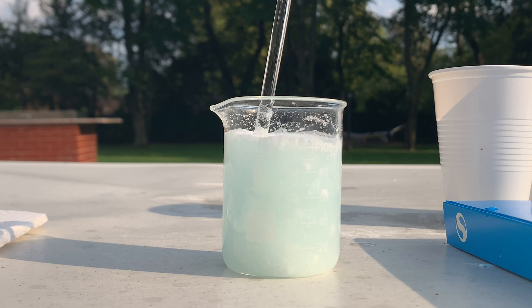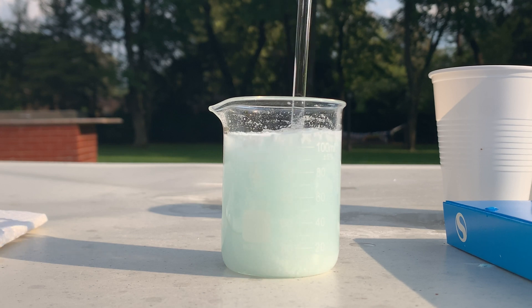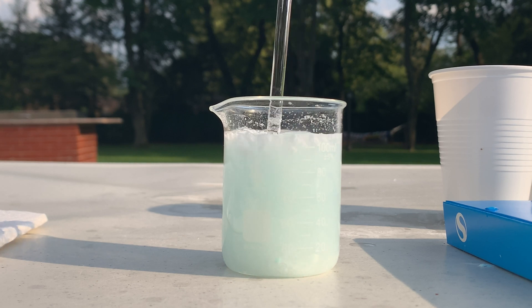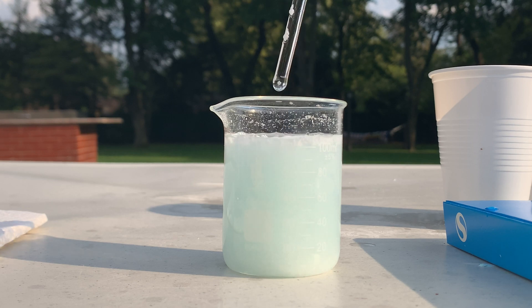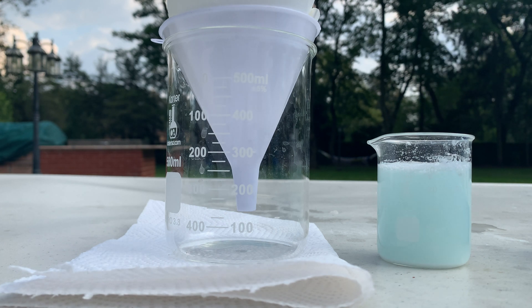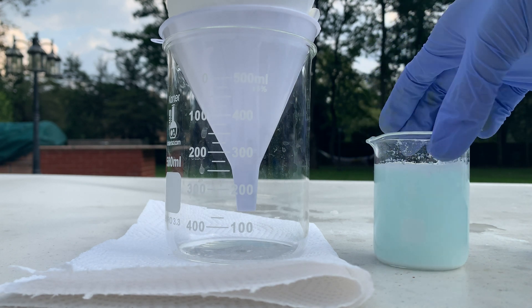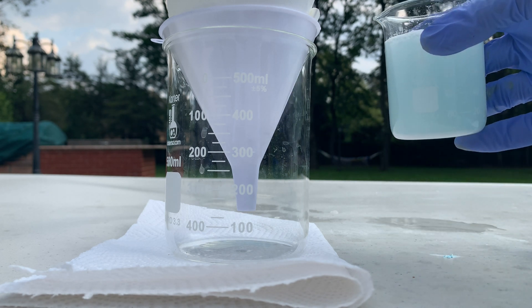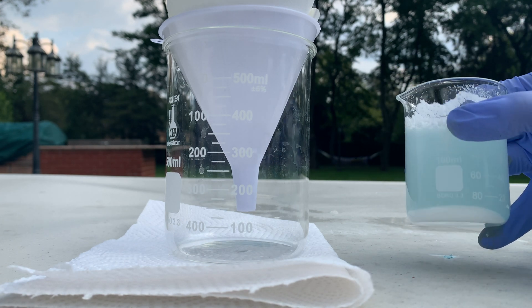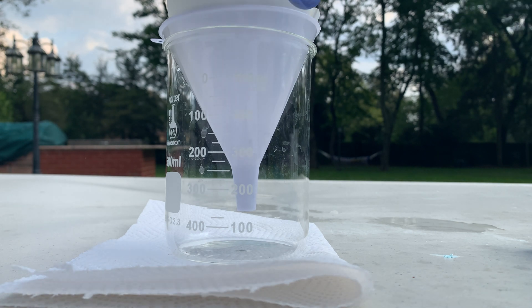I'm waiting for the copper salicylate to start precipitating. I'm not sure what color it is — I've seen one picture of it being green so I'm not completely sure. I'm going to let this reaction sit for a bit and come back for the filtration. After about 10 minutes, I'm going to run it through some filter paper. The solution has turned a bit green, so we definitely got some copper salicylate forming, but I'm starting to suspect there's some excess salicylic acid — maybe I didn't weigh too exactly.